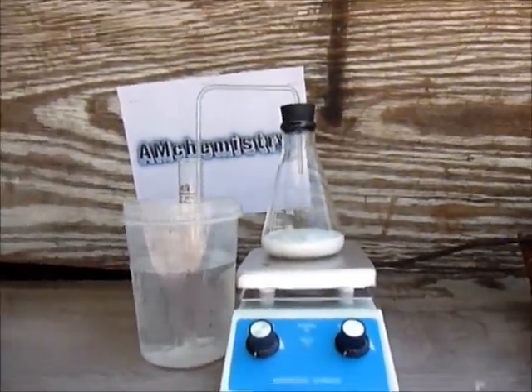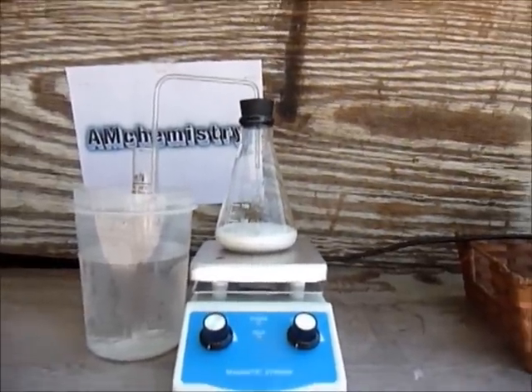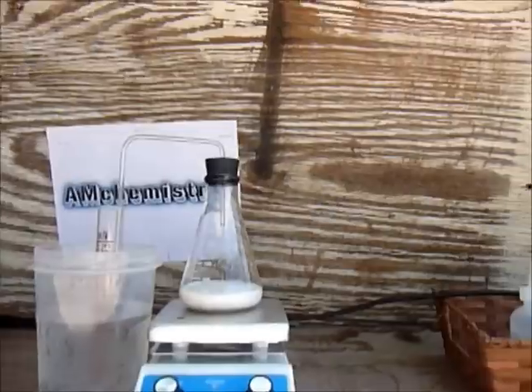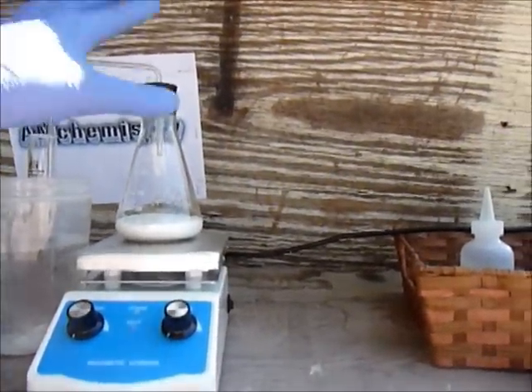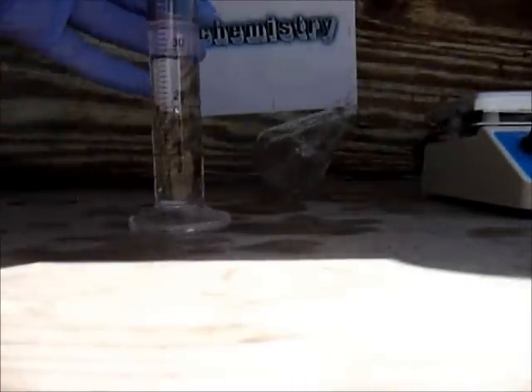Be aware that it's going to reflux. I'll show you when it stopped refluxing and I have everything out. Now I'm finished and you can see I emptied out everything. Here's the product.